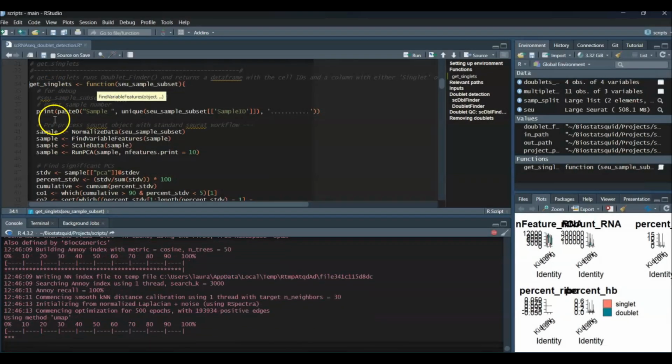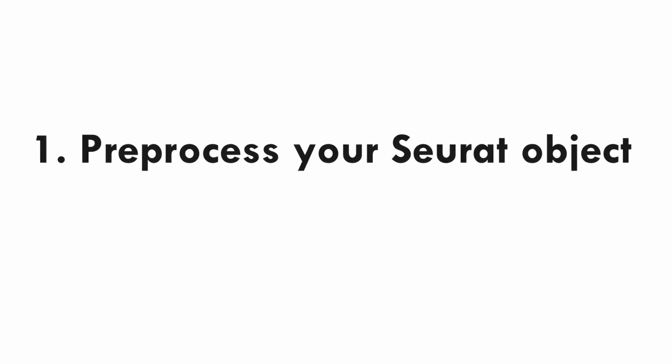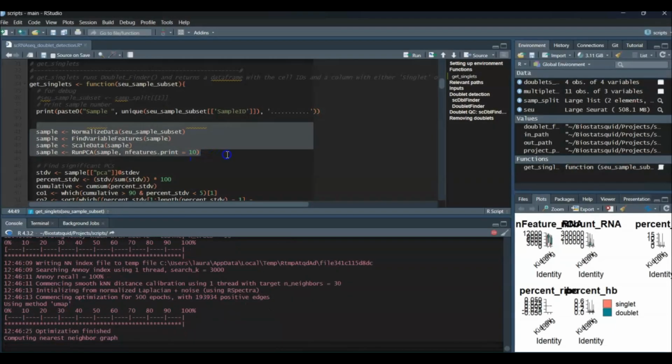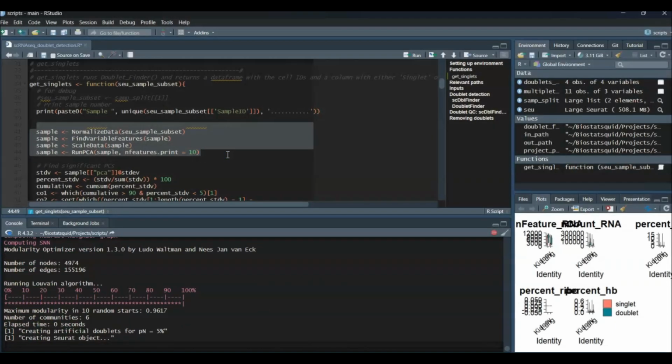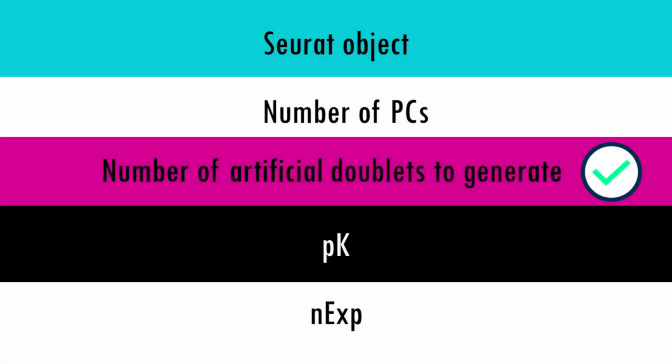First, the Seurat object needs to be fully processed. The Seurat object I'm using has not yet been processed, so let's take care of that now. This is what these 4 lines do. They're just the standard Seurat workflow. Great. Another argument figured out.